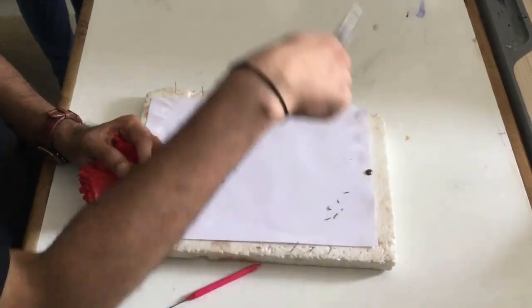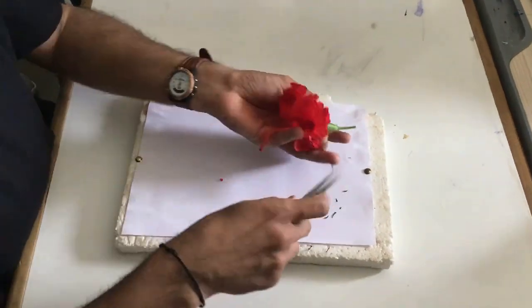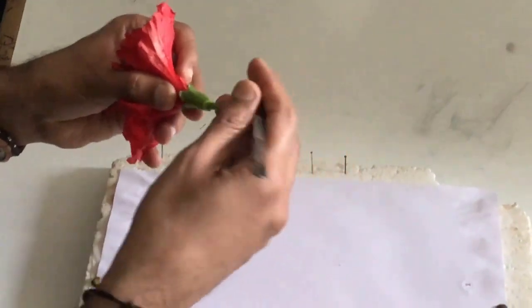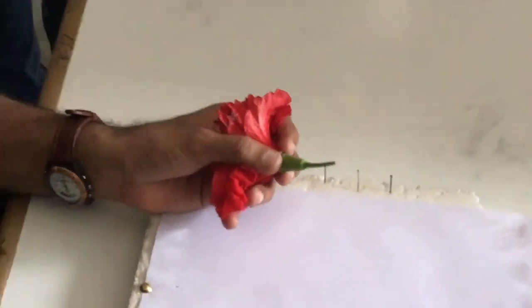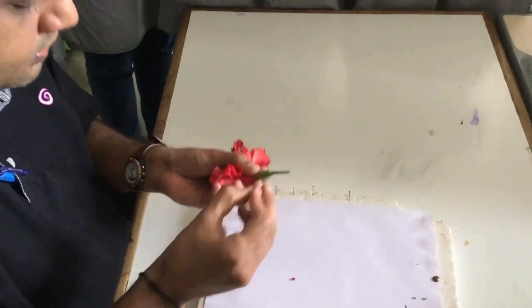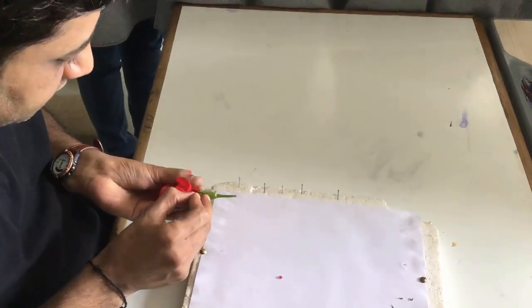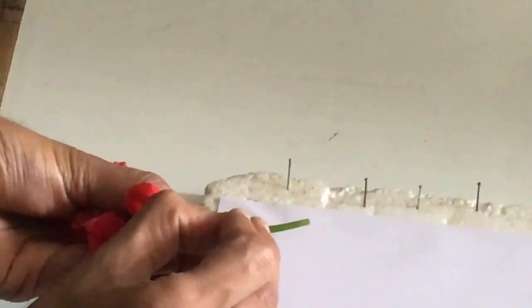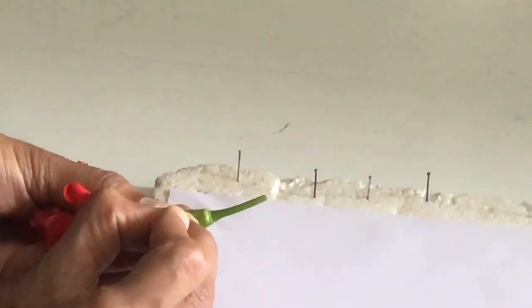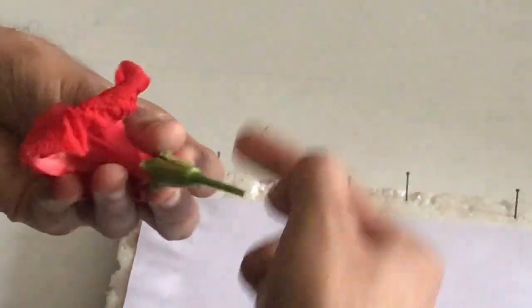The order is: first epicalyx, then calyx, then corolla, androecium, gynoecium. To remove the calyx, since it appears like a jug, I will use a pin and draw one line meeting at the center. Cut it like this — horizontal line, vertical line — making incisions carefully so that the inside parts are not damaged.